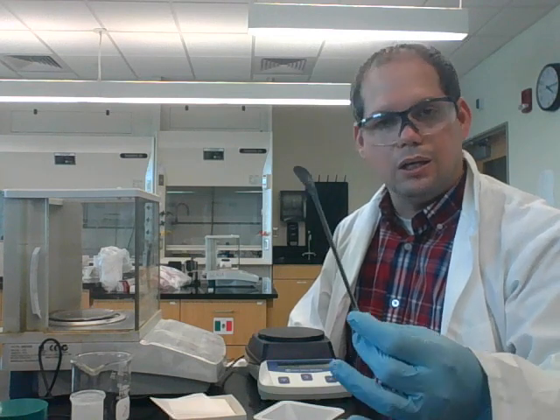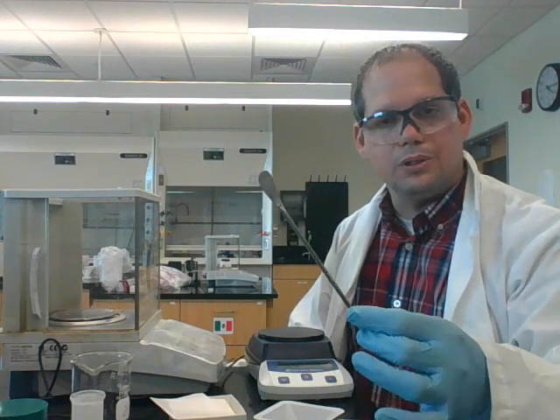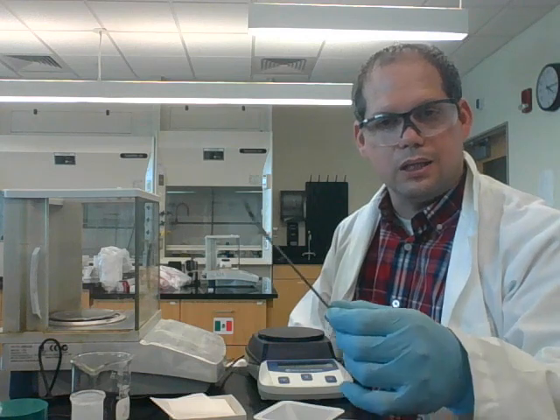As far as transferring chemicals from a chemical bottle to a container that you might use to weigh out that chemical, there are many spatulas you can use. So there are in our lab three different types. There's this type, this slightly smaller one, and this one that has a curve on it. It honestly doesn't really matter too much which one you use. They all serve the same purpose.